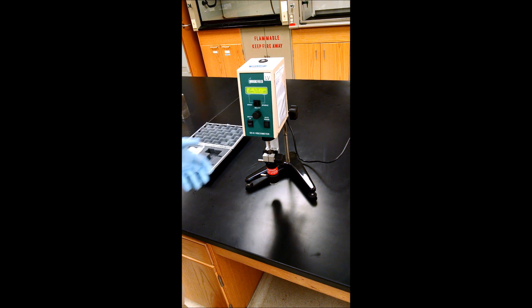To disassemble, just reverse the steps that we did to assemble the ultra-low adapter. And then clean and wash out all the parts before putting away.